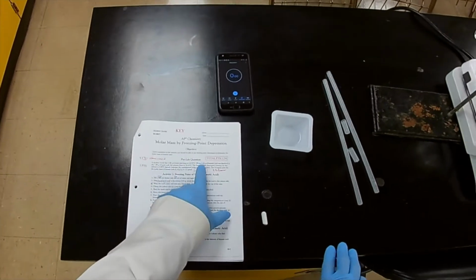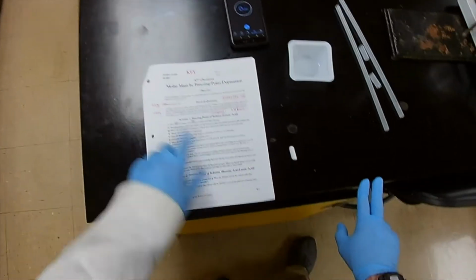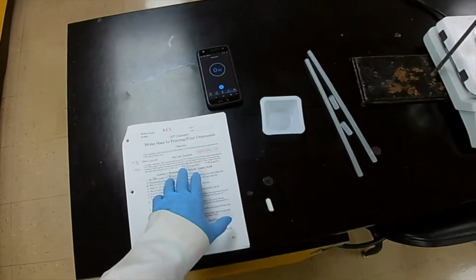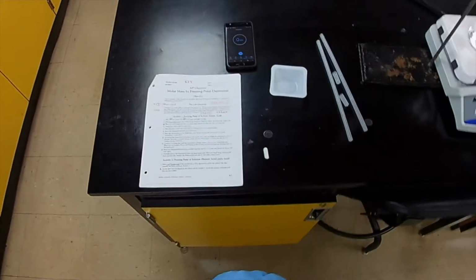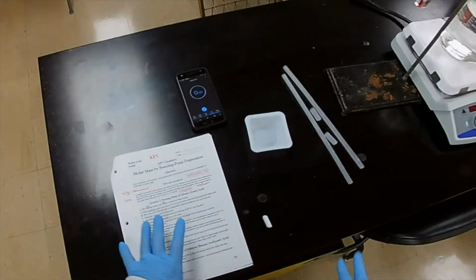Now, when we get all our data, I'm going to go in here and take this pre-lab question and work out this pre-lab question, which is good for you because it's worth 5 points. So if you pay attention and you answer this question in the document, when you turn it in, and show me your work, because this is a key and you can see the answers, but you got to show me your work. You got to prove to me that you arrived at that calculation. Then, I'm going to show you how this calculation is done to answer the question, and you'll use a similar method to that to calculate the experimental molar mass of benzoic acid.